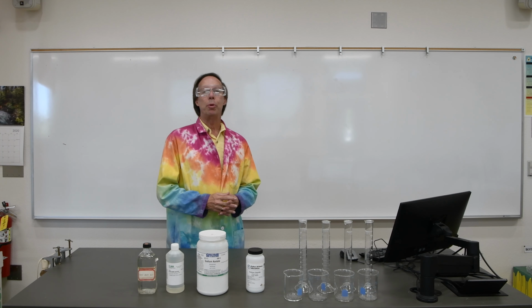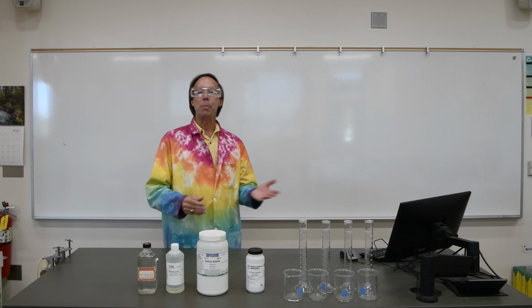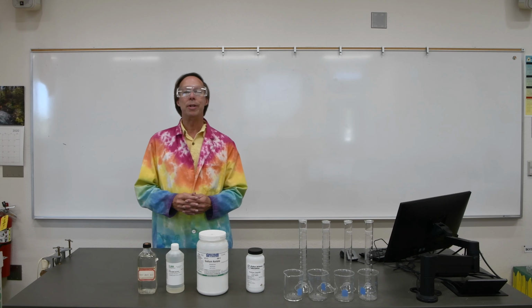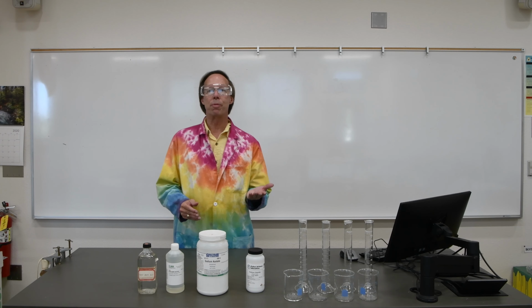Good morning, everyone. Today we're going to be doing experiment number 19, which is sort of an extension of experiment number 2 we did earlier in the semester because it once again deals with solutions. But this time we're going to go into much greater depth. You're going to be making solutions of 4 different compounds.